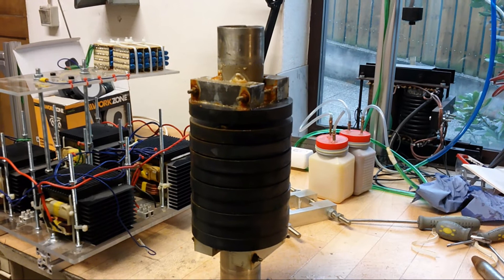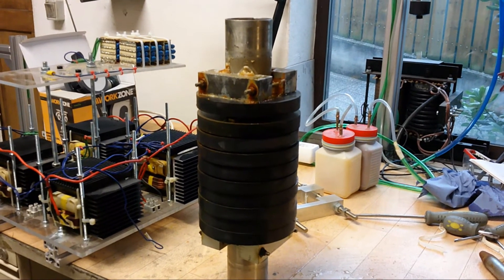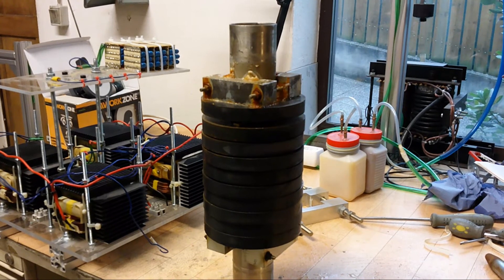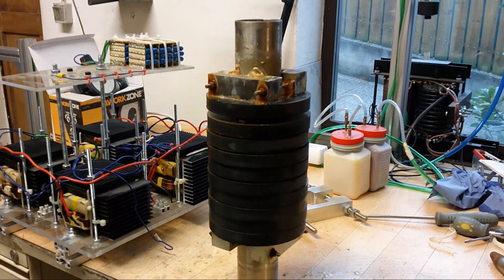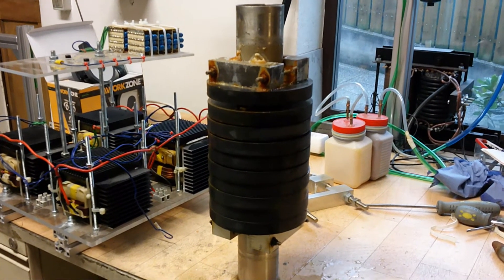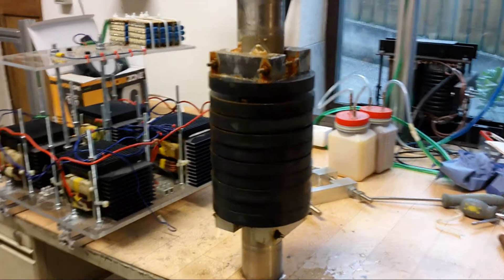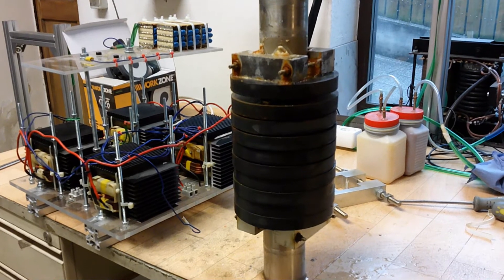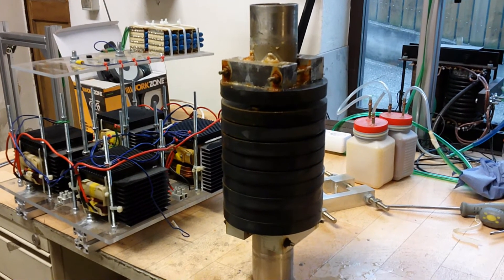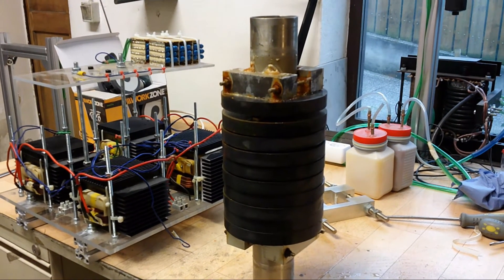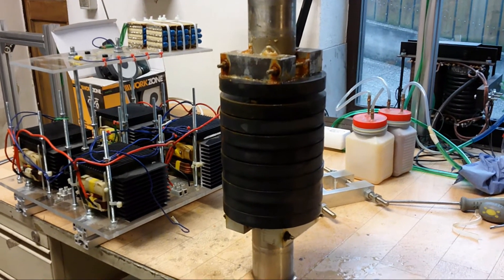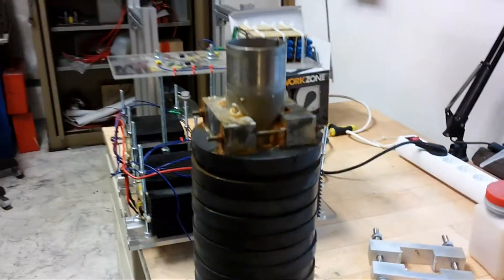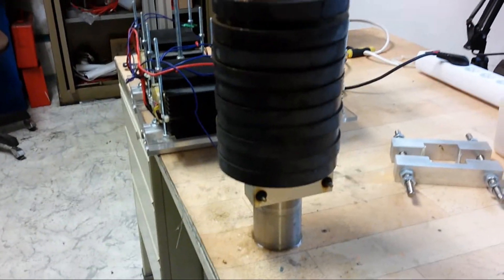It's due to the magnetic field. I do not fully understand why the plasma is doing that, but it is like it is. So the magnets are actually used to keep the plasma from burning on just one spot. That's it. Now I am going to clean that up.